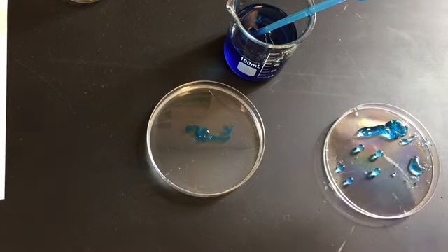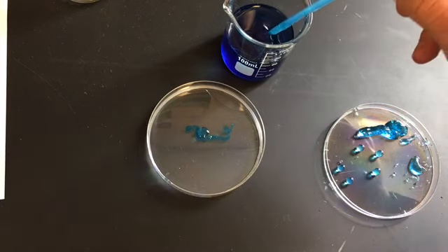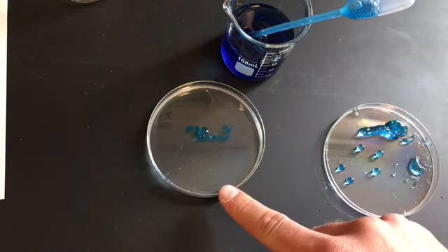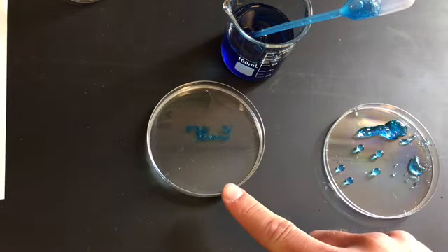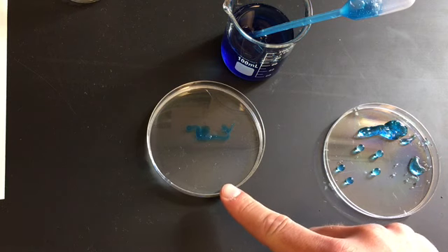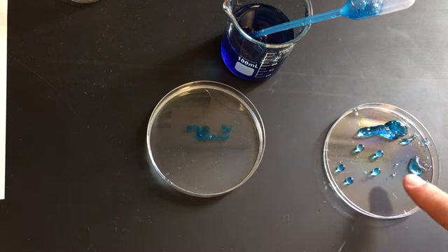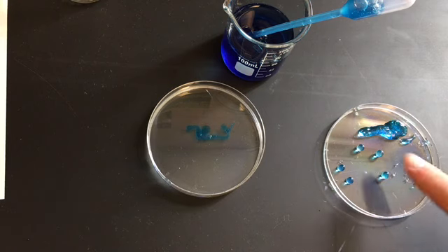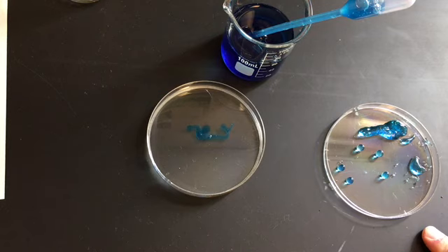Point out some obvious things here. It starts out as a thick liquid. When I add my sodium alginate to the calcium chloride, something happens almost immediately. Okay, it condenses into this gel-like substance that encapsulates the blue color. And I want you to write in your See, Think, Wonder chart what you see, what you think is going on, and what questions you might have that might help us solve what's going on.